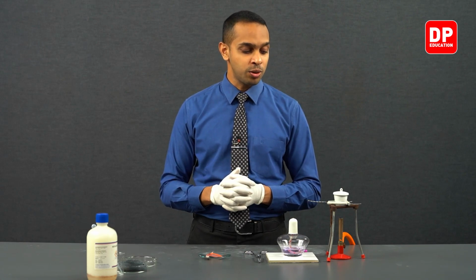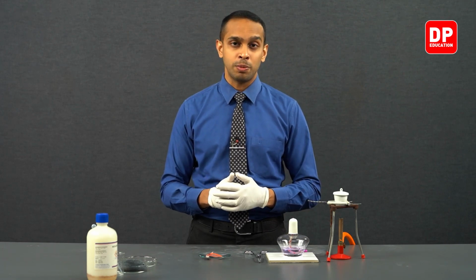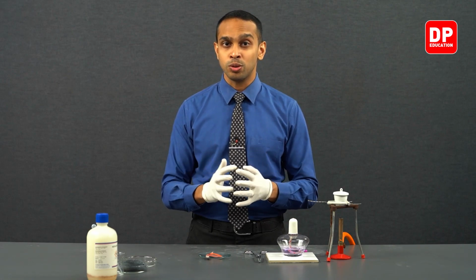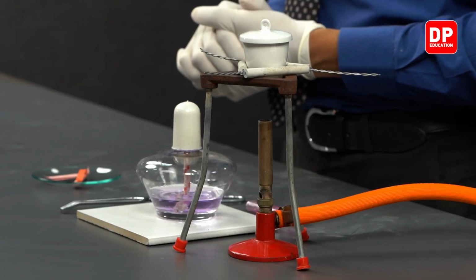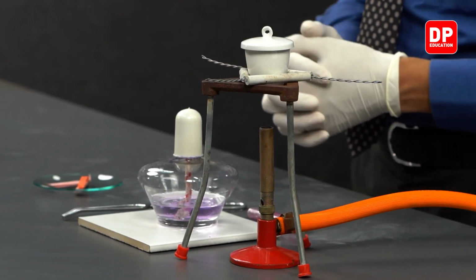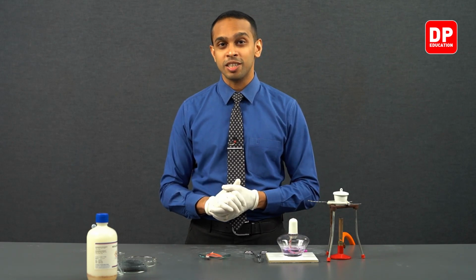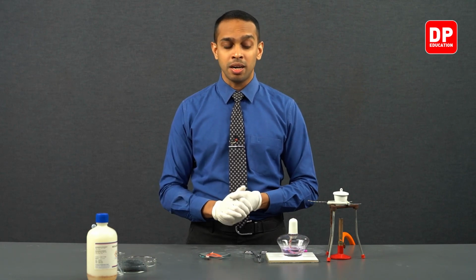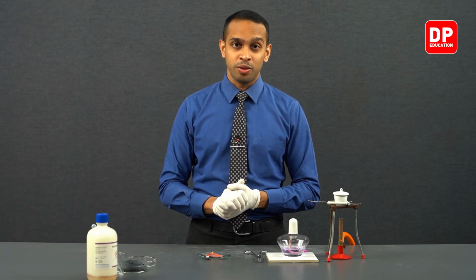Now, without further ado, let's move on and conduct this experiment. Since we know the steps of this experiment, you can expect different observations in each of these steps. First, let's turn on our Bunsen burner and start heating the crucible. After the crucible is hot enough, we will take the magnesium strip, heat it up, and include it in the crucible to see the reaction.